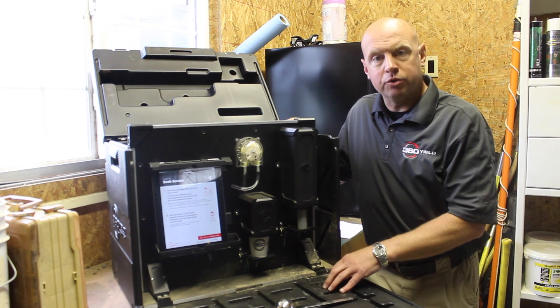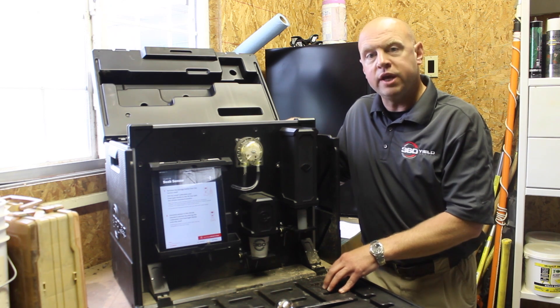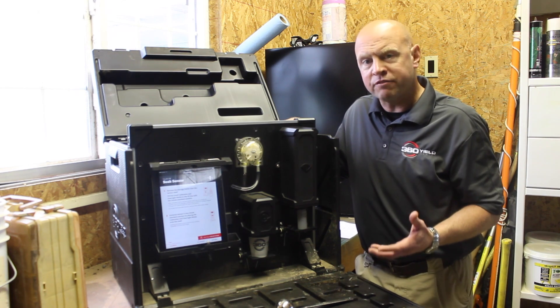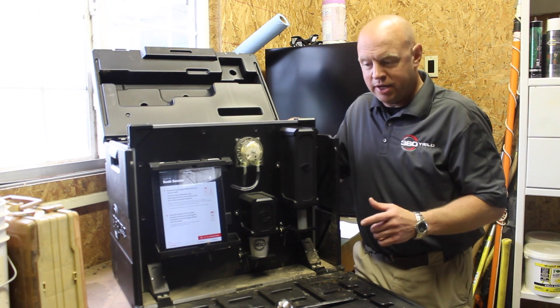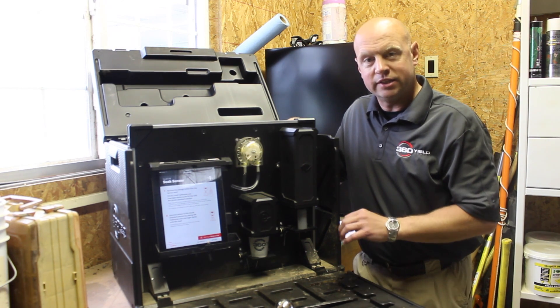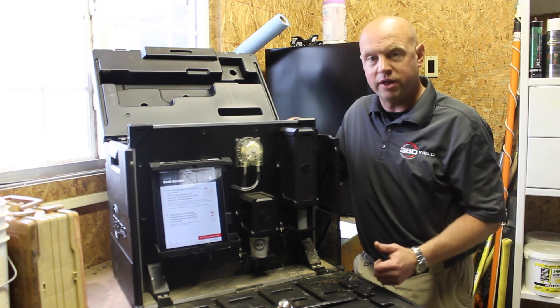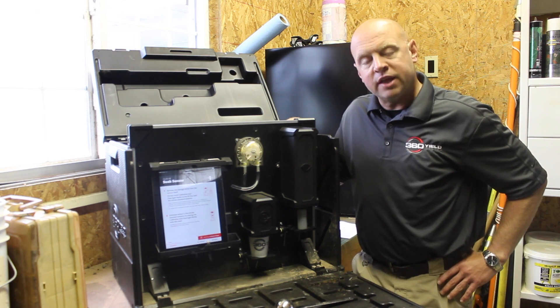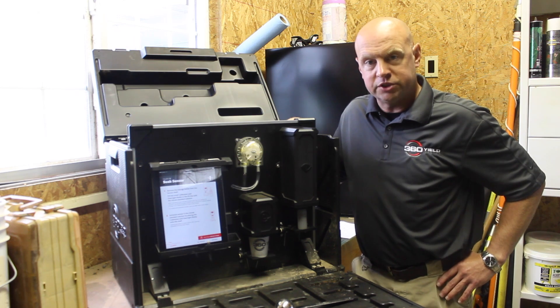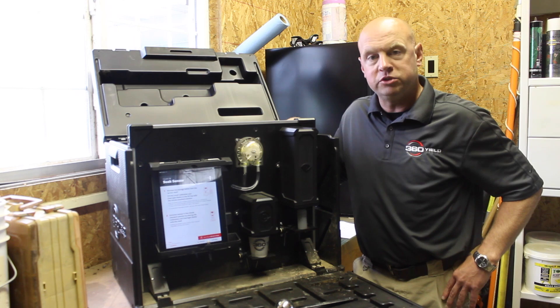After calibration, I want to reference a recent video by Jason Keenus, one of our research agronomists here at 360 Yield Center, where he talked about the proper way to do soil samples in the field. Where he left off was mixing that soil — he referred to the samples coming out of the core as carrot sticks. It depends on soil texture and moisture how you'll need to mix those samples to get one good homogeneous mix.